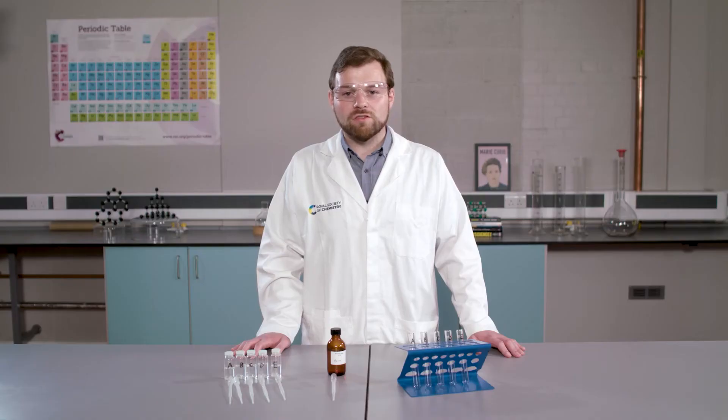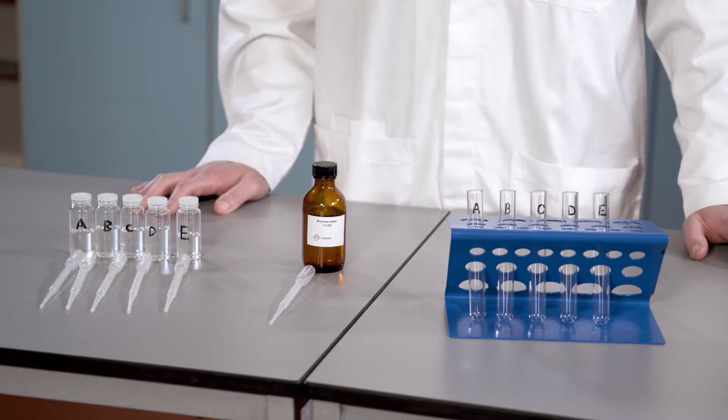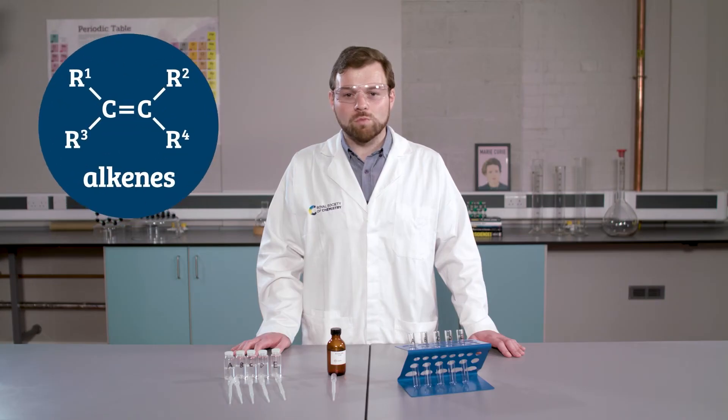Next, I am going to perform a test using bromine water. Again, you have probably done this before. Here I am testing for an unsaturated hydrocarbon, or the presence of a carbon-carbon double bond, and we would expect to see only one positive result.